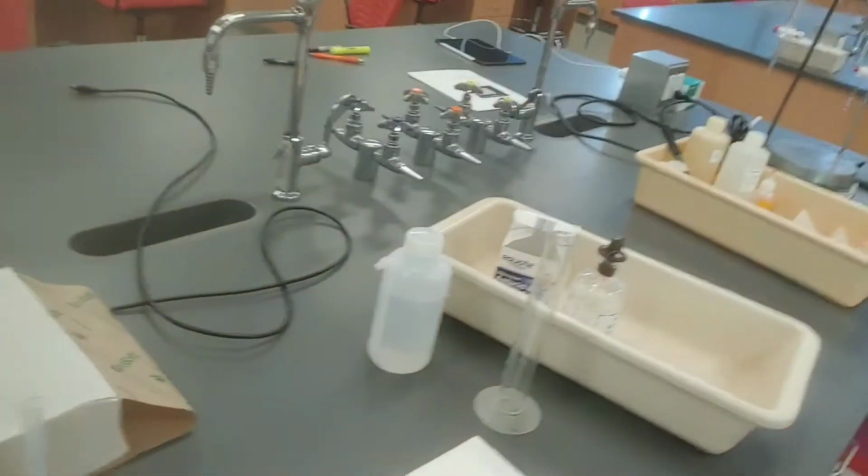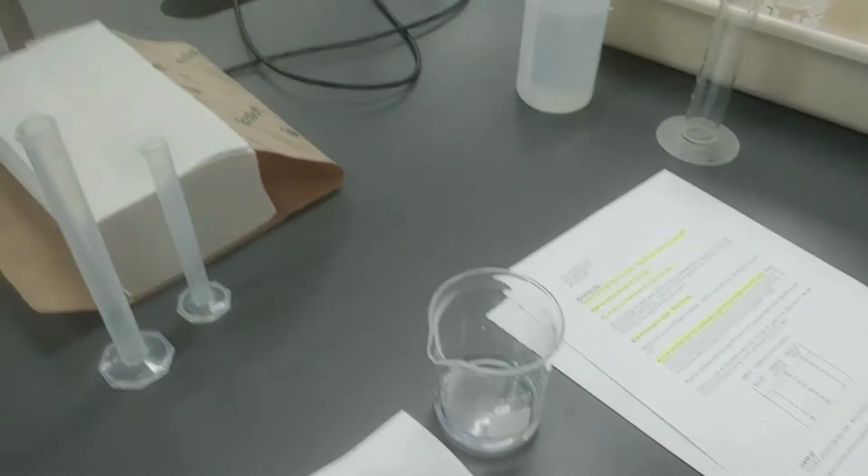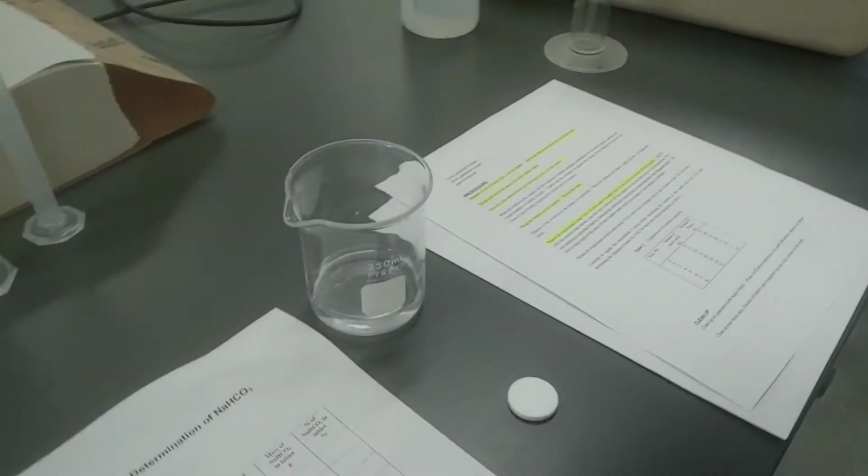All right, I'm here in the lab. I am ready to go. Just wanted you to see that I'm prepped. Gloves, lab coat, safety goggles, and closed-toed shoes, right? If you can see the closed-toed shoes. And so here we are ready to do the lab. So we have our beaker of water, we have our Alka-Seltzer tablet, and we've got our data form, so we're all set.